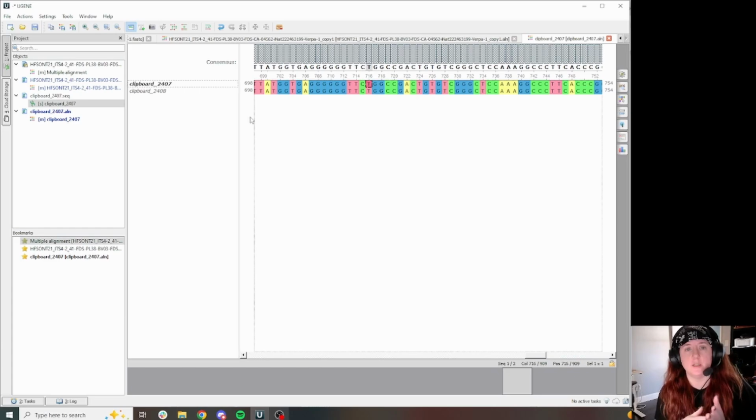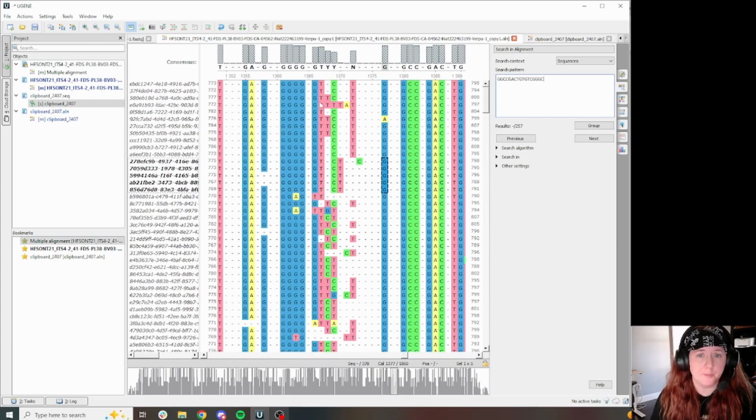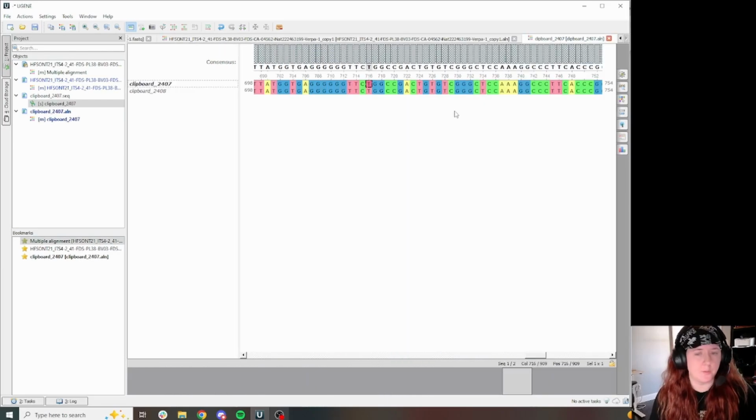that is showing in some of the other comparative specimens, and that I'm pretty sure is probably real in at least one haplotype. But anyway, I hope this was helpful. It's just a quick little tutorial on how to maybe approach a more difficult alignment issue.